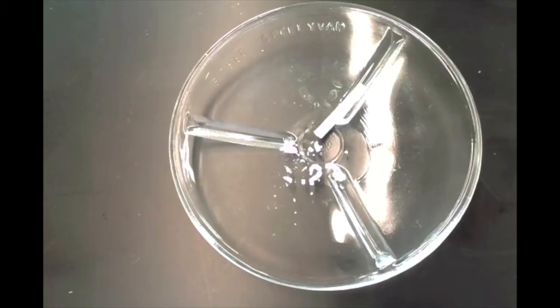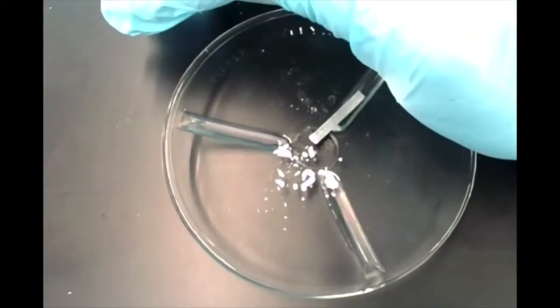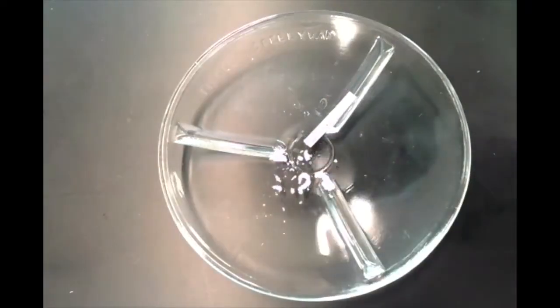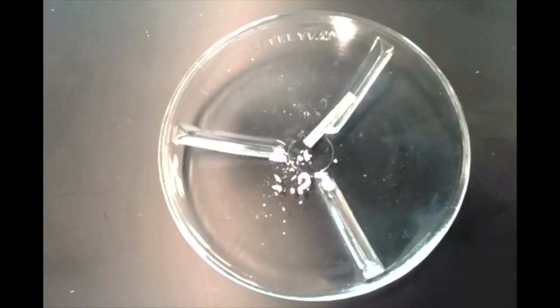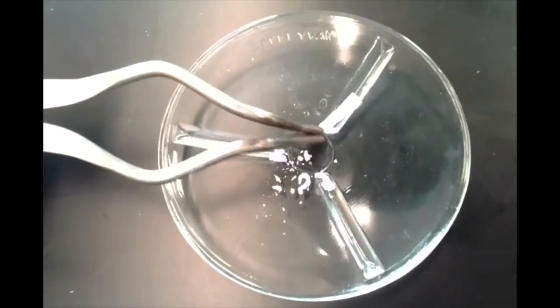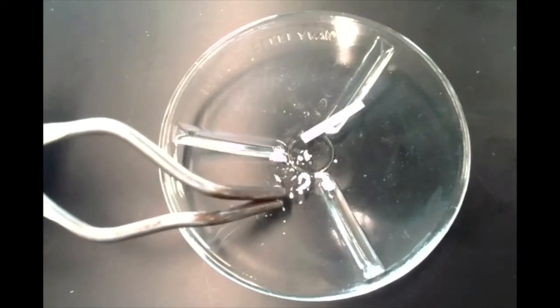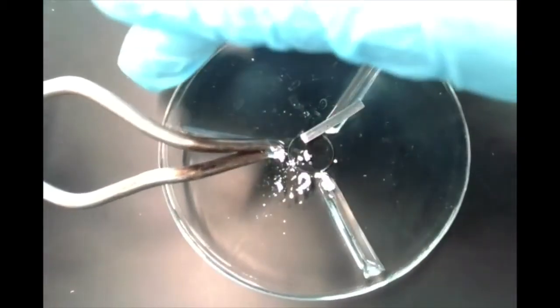All right, I've moved the camera and our little watch glass with the magnesium and the product, magnesium oxide, away from the fume hood, so hopefully it's a little bit easier to hear me. I'm going to put my hand over this so the glare of the overhead lights hopefully allows the camera to focus a little bit, and you can see over here we have the original magnesium metal, okay, but you can see here we've got this white powder. I mean, it's probably hard to tell that the magnesium metal is gray. Maybe if I cover, there we go.